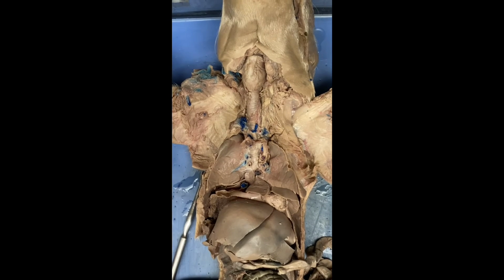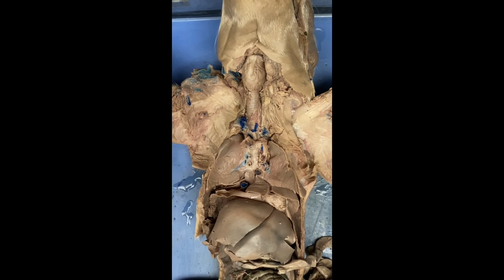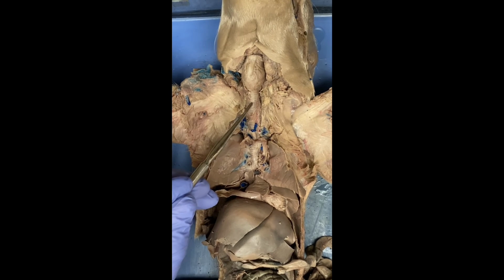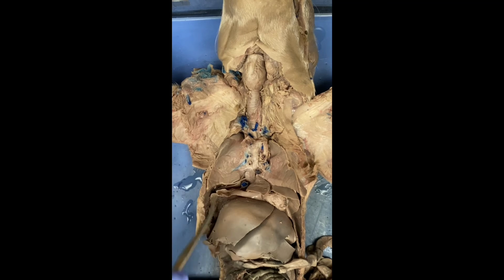All right, we have now moved on to the respiratory system of our fetal pigs. So the respiratory system is a lot more simple compared to the circulatory system. So we'll start off with probably the most obvious part, which is going to be the trachea, which is this right here, and it's going to go down. And the trachea's responsibility is it transfers air from the mouth to the bronchi, and then to the lungs.